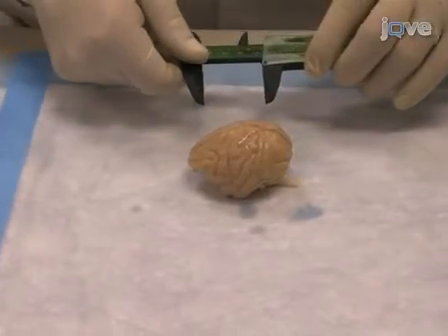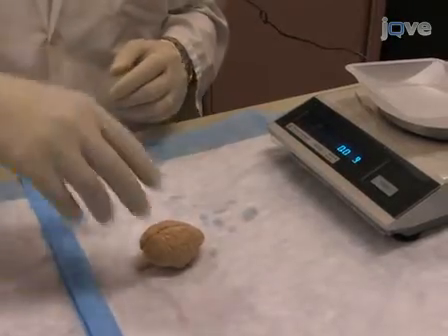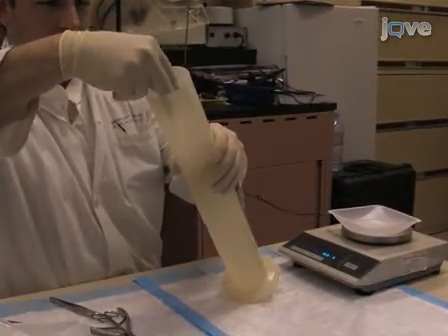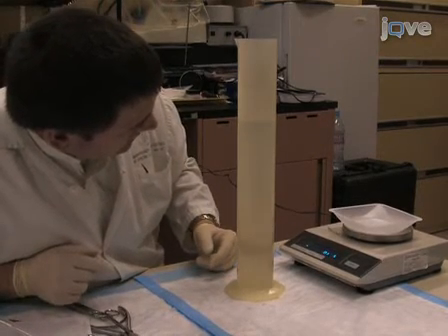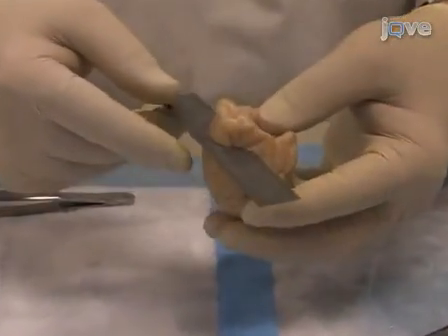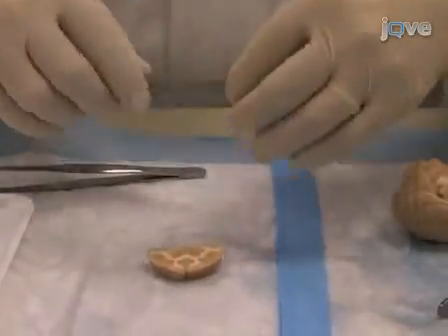There are a number of useful measurements you can make before you freeze the brain. First, a caliper can be used to measure the AP axis of the brain. Next, find its specific density. Weigh the brain, then measure the volume as the displacement of water in a graduated cylinder. Now you have the density: mass divided by volume. Now that you have made measurements on the whole brain, it is time to release the individual blocks of tissue from where they are attached on the brain's ventral side and prepare them for freezing. Take a tissue slicing blade and extend each cut through the ventral side of the brain, releasing the blocks.